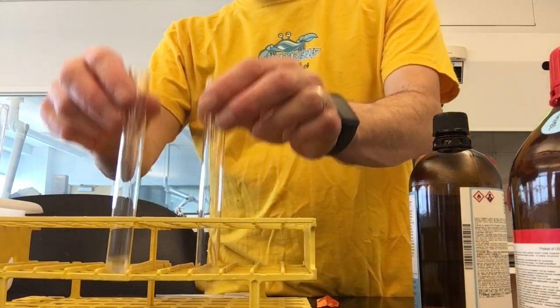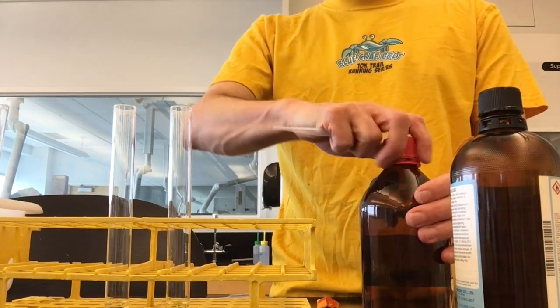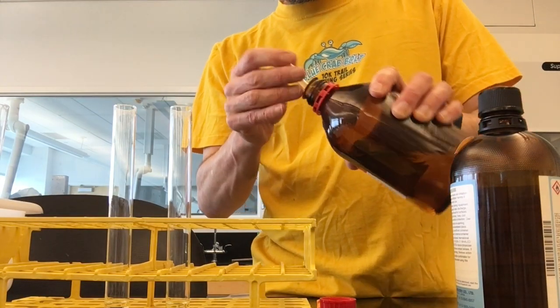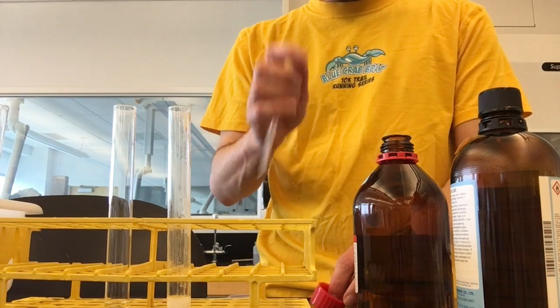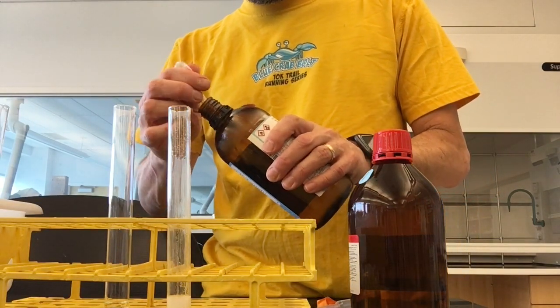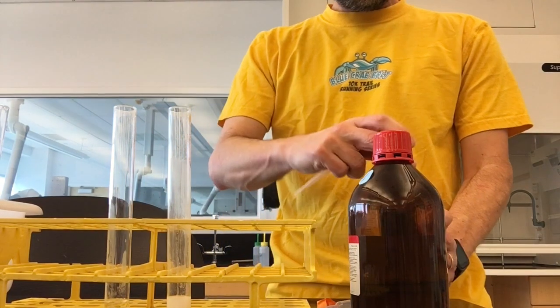I have two test tubes, both filled with one milliliter of sodium iodide in acetone. To the first one I'm going to add ethyl bromide, which is a primary bromide — about five drops. And I'm going to do the same thing to the 2-bromopropane, which is a secondary bromide — five drops — and I will shake them both up.